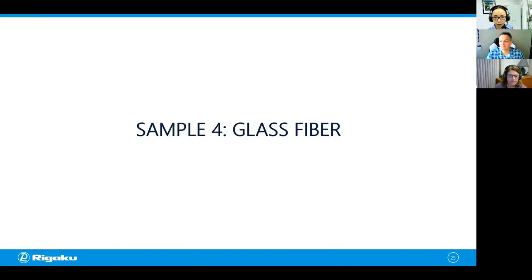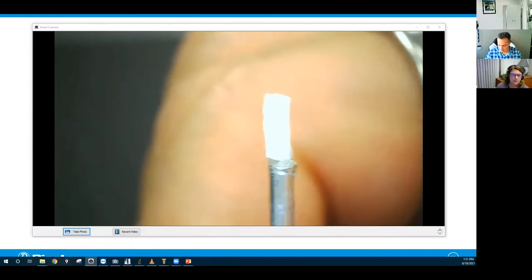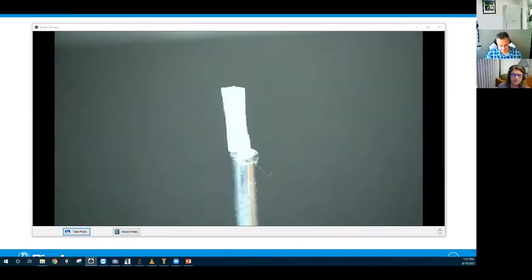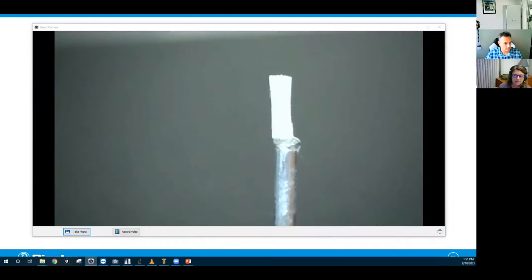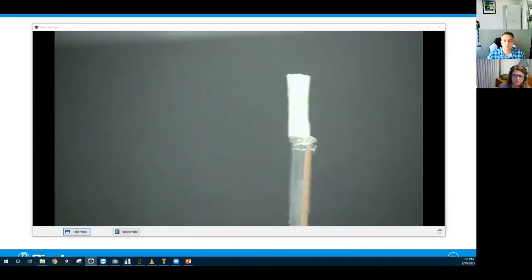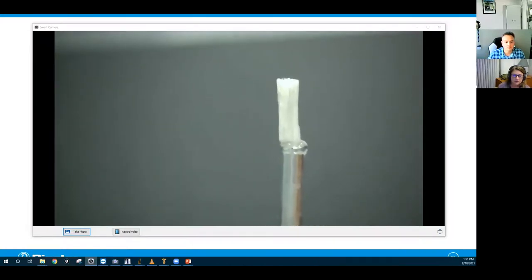All right, so this is a glass fiber sample, and Aya is going to show us what that sample looks like. Mm-hmm. And I'm going to launch a poll related to the sample, again, asking which energy should we use? And in this case, we have glass fibers. So please select the vote for the energy that we use in this case. Give everybody a couple of seconds. I guess you don't see much in the sample, but this is like a bundle of glass fibers.